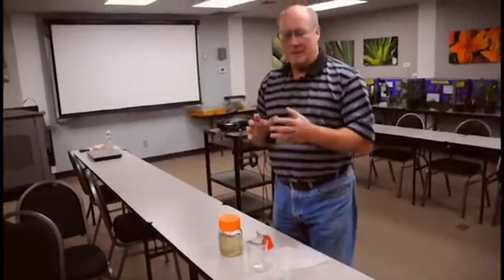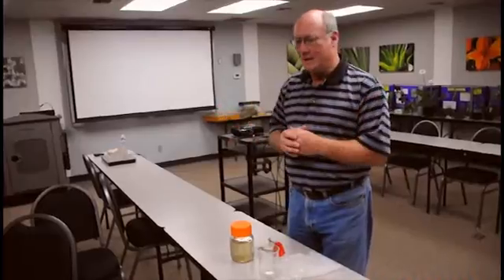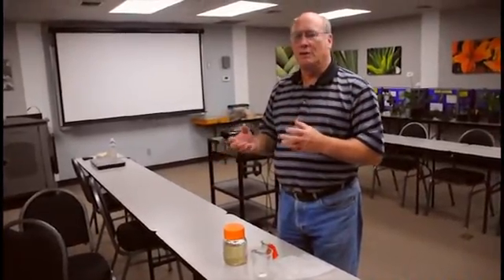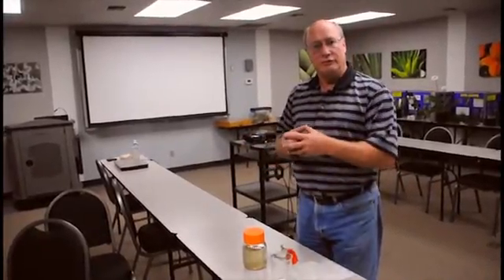Okay, one method that we always talk about for sampling for thrips or other insects, even mites for that matter, would be to put a sample in alcohol and allow the sample to sit there for a little bit, maybe shake it a little. And what you're doing is you're either killing the insect or coaxing it off of the sample into the solution.